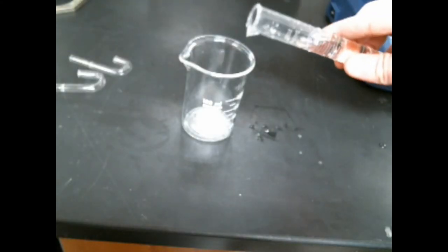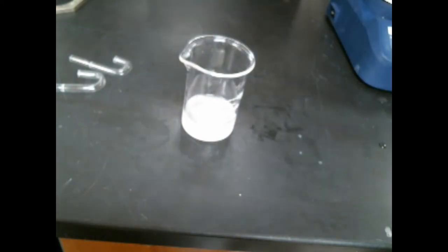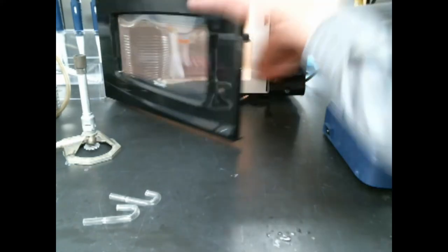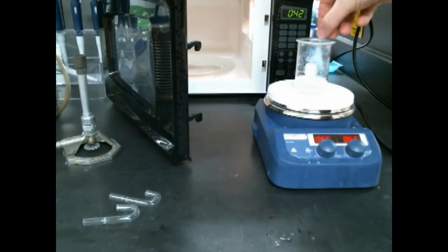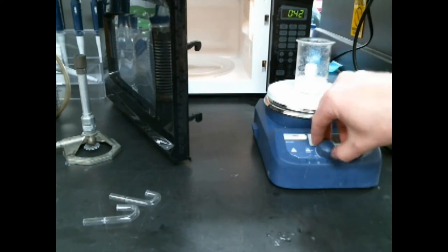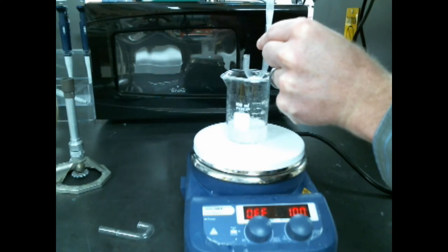We're going to get some potassium chloride and add agar to it. That'll make a nice gel that'll hold the solution into the U tube, the other kind of U tube. Mix that up on a little hot plate and then it'll melt and we add that to the glass tube.